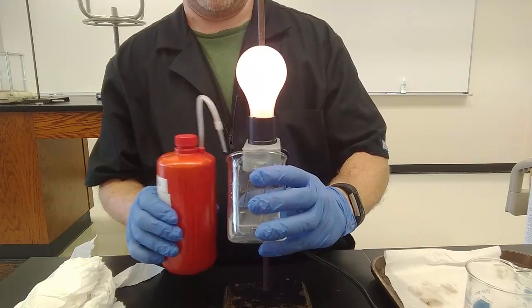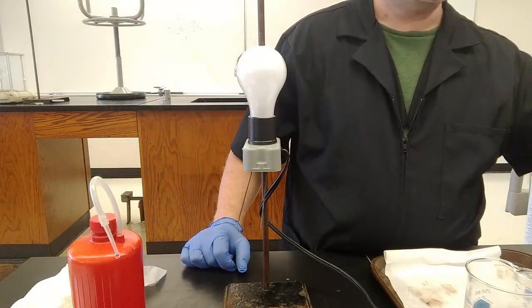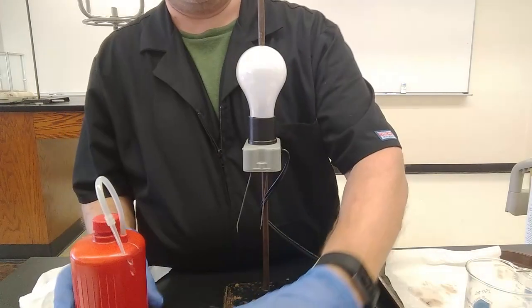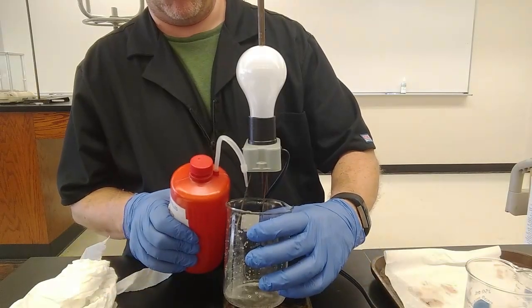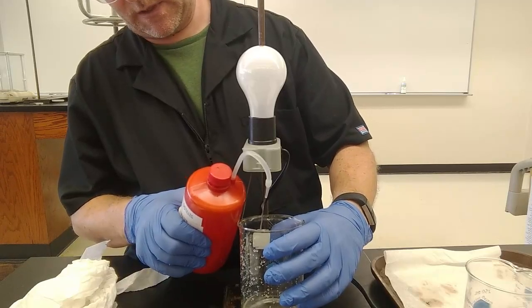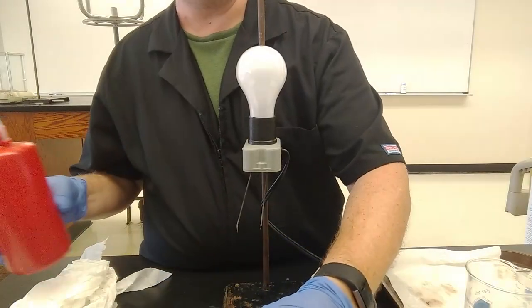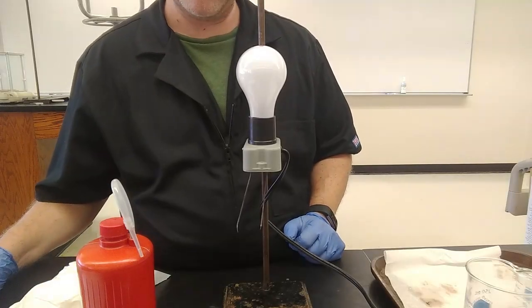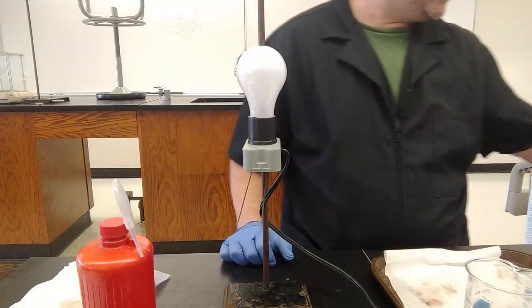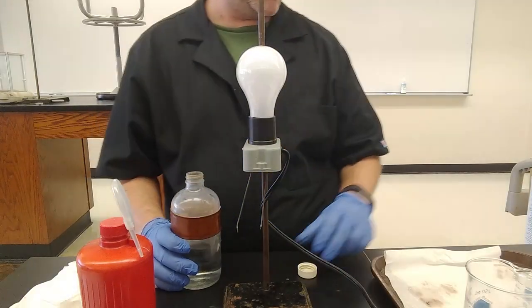If I do that with a strong electrolyte, it doesn't change, because I already have the maximum amount of ions that I'm going to get. It doesn't ionize any further. No more ions occur when I add water. Because of Le Chatelier's principle and the Ostwald dilution law, if I add more water to a weak electrolyte, I actually end up generating more ions. Let's try it with ammonia, which is a weak base. I'm giving away the answer again.